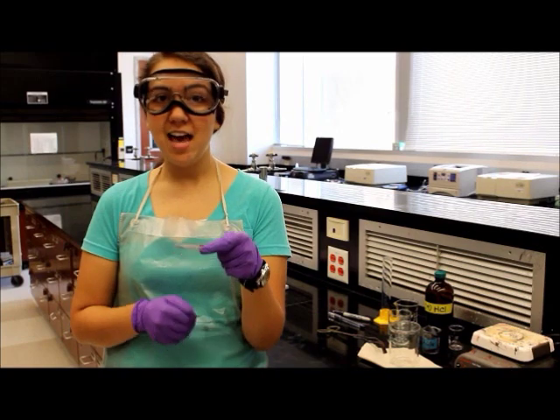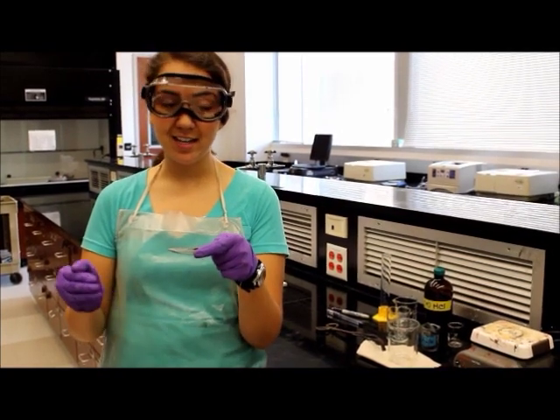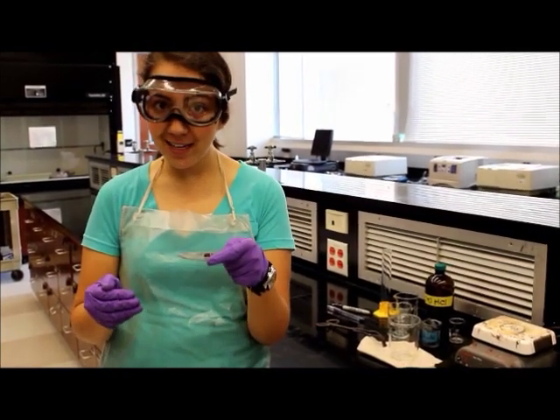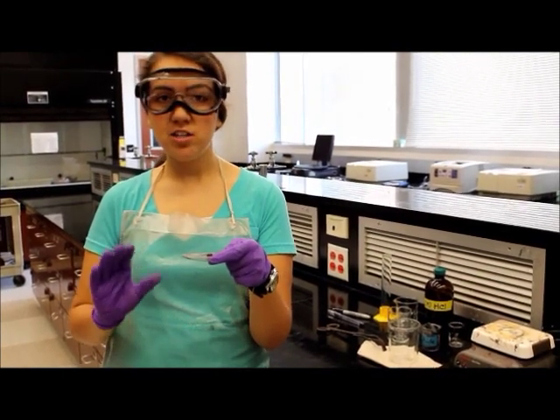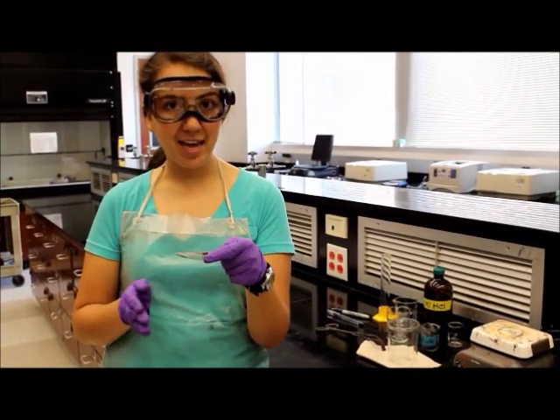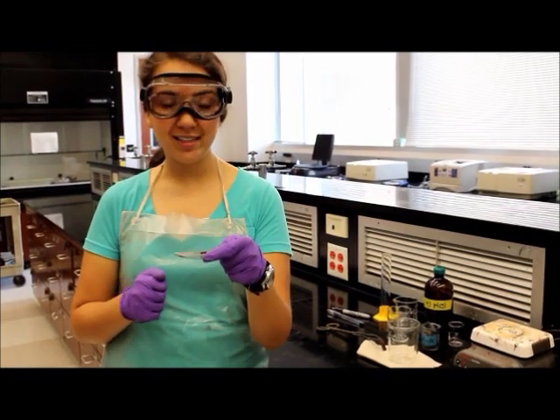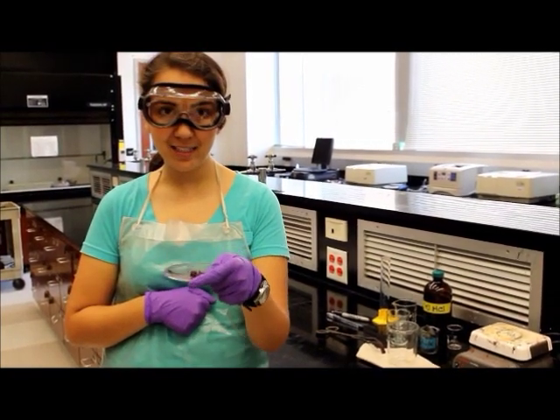Also, don't check on it every 15 minutes because everyone else will be checking on it about every five minutes. Check on it maybe 20 to even 30 minutes at the beginning because you want this to dry as completely as possible.